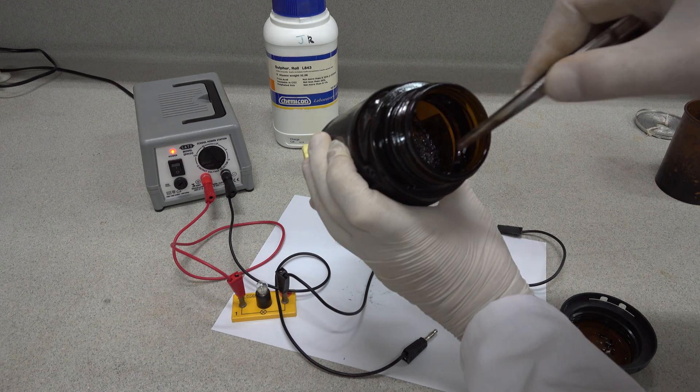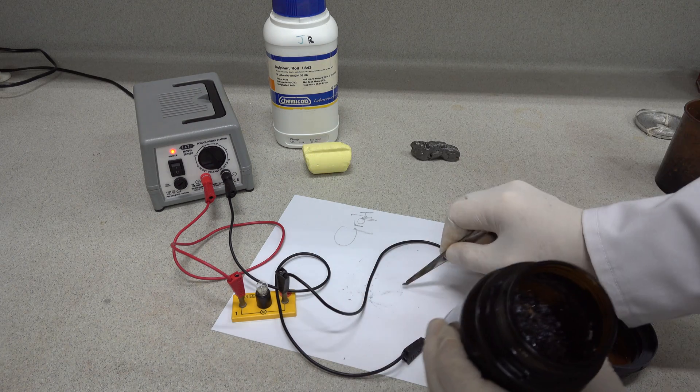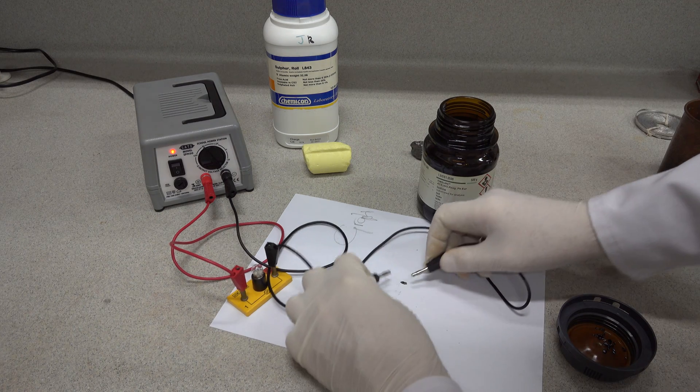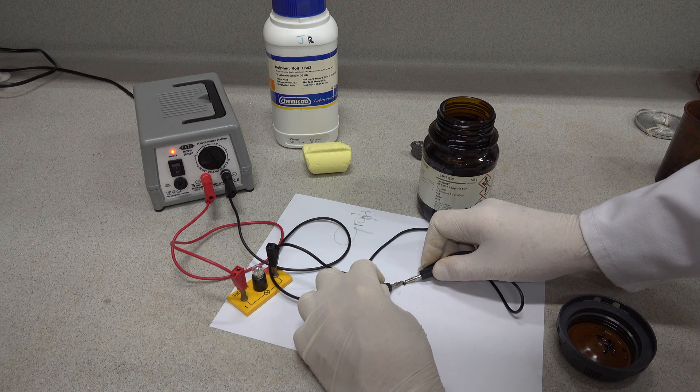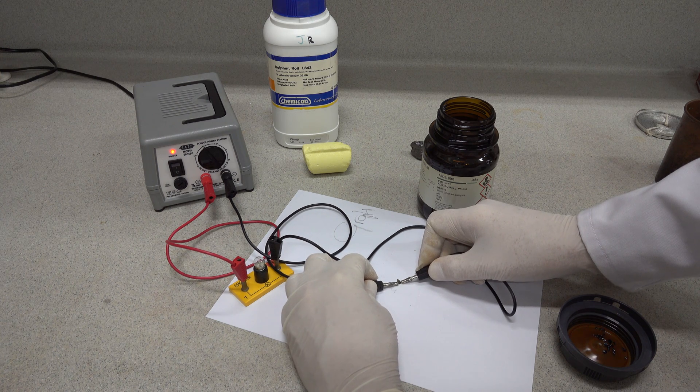Here, if we take a nice big crystal out there, we find one and encourage it to come out. There's the iodine. And if we attach the contacts to that, you can see in this case, no, the iodine does not conduct electricity.